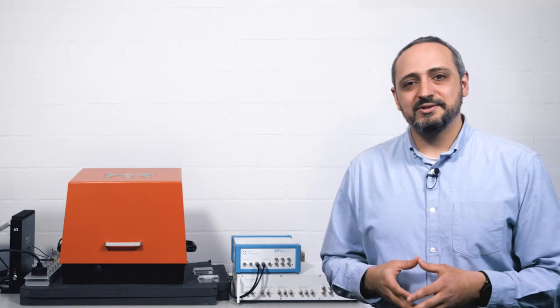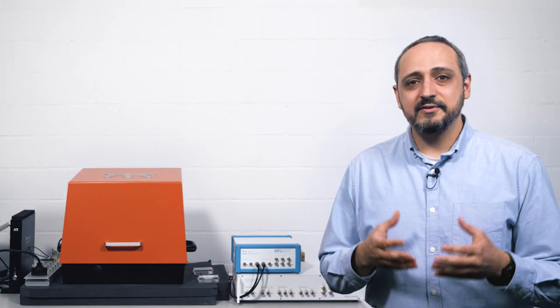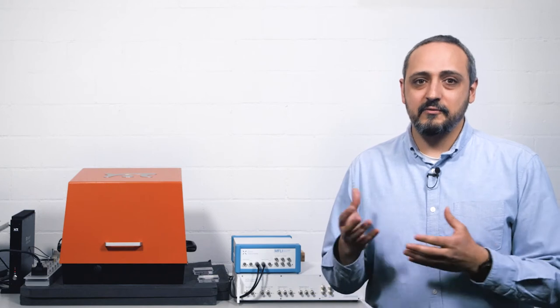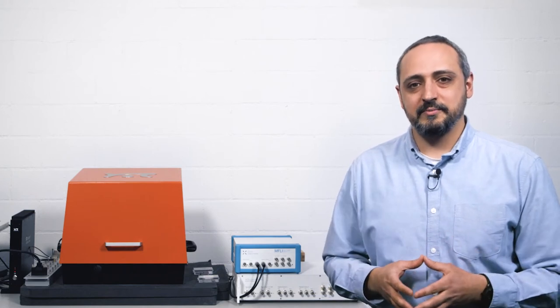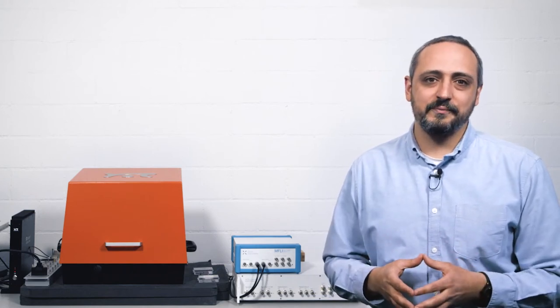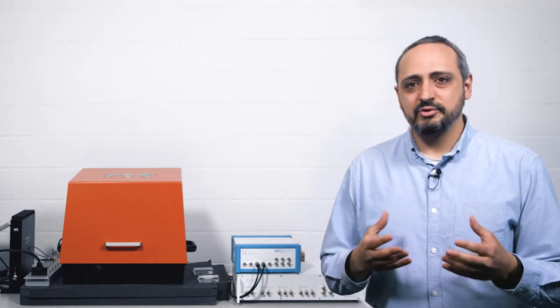Exploring new AFM operation modes does not require a brand new microscope. In this video, you will see how a Zurich Instruments Lock-in Amplifier can enable different imaging methods in your atomic force microscope, this time focusing on Kelvin Probe Force Microscopy, or KPFM for short. Welcome to the Zurich Instruments channel. I am Kavanj and will guide you through the setup and workflow.